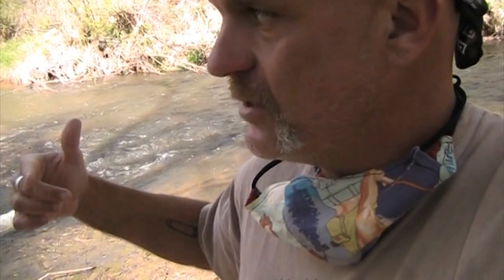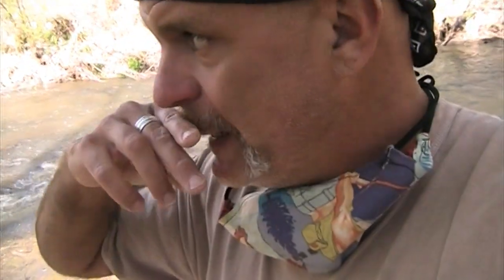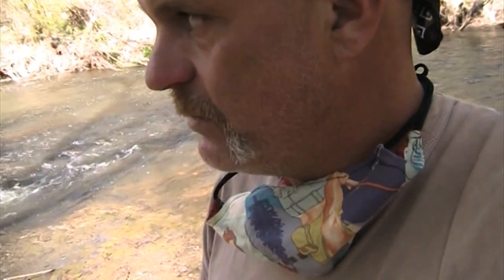So those are two things, but I'm also going to show you today how to sample some other things. Those things are going to include invertebrate sampling as well as dissolved oxygen. Now, the cool thing to see when you're doing river sampling is also recognizing when some place is a safe approach.